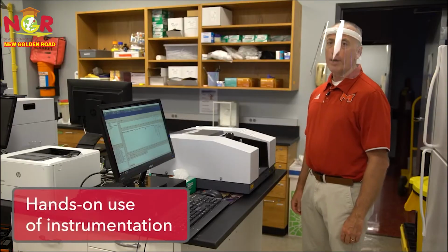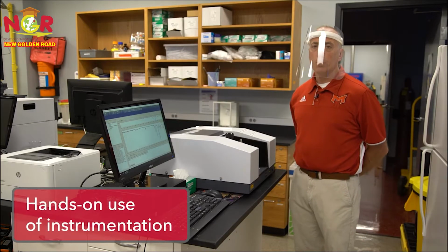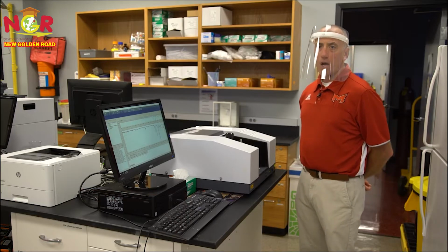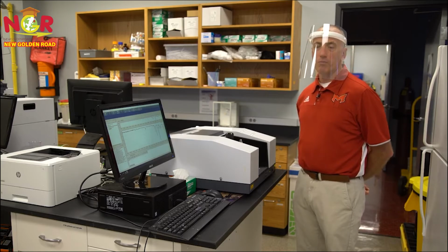This is our Fourier transform infrared spectrometer. We can use this in organic as well as instrumental analysis, and we use it to determine different compounds that have been either synthesized in the lab or identify compounds that have been extracted.